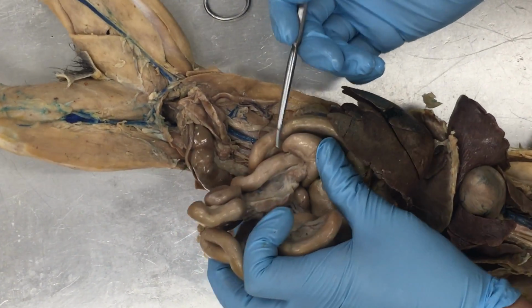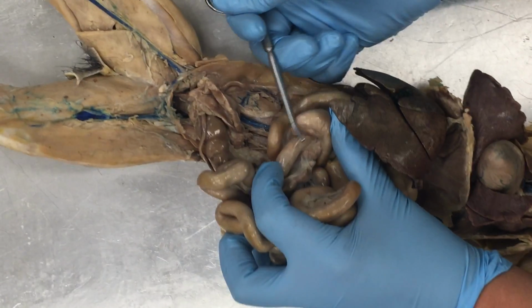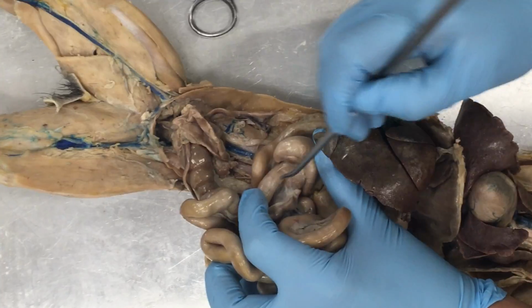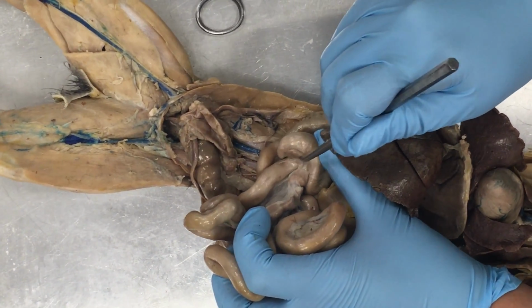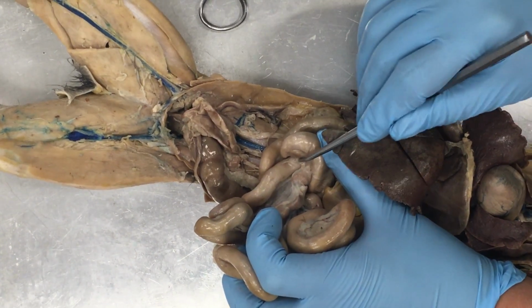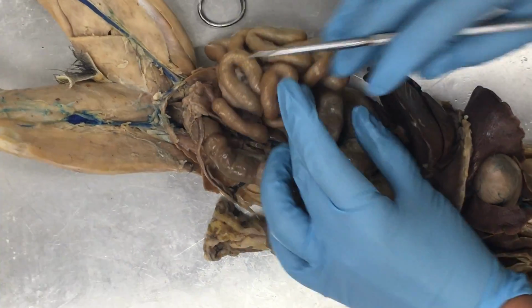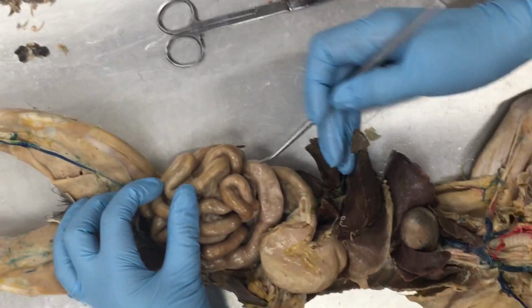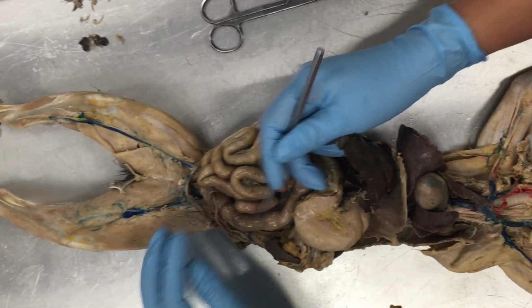The first portion of our large intestine, it's this little sort of nub that hangs over right here. This is our cecum. There is another sphincter that's right where these two intersect. So where the ileum and the cecum meet, right here, there's another thick muscular ring. That's called the ileocecal sphincter, literally for ileum to cecum, there's a sphincter. From there, we go into our large intestine. I'm just gonna hold that off to the side. Our cecum was here, and we can see it's got this sort of curved loop shape to it.